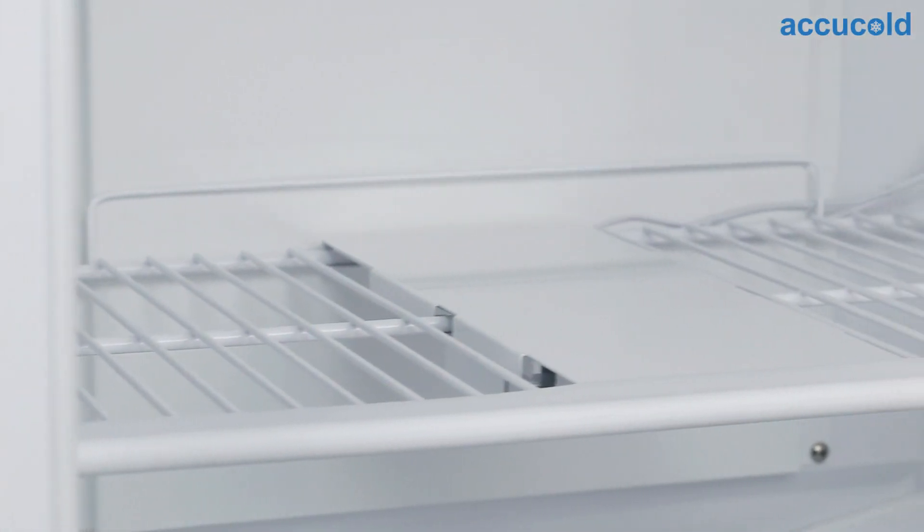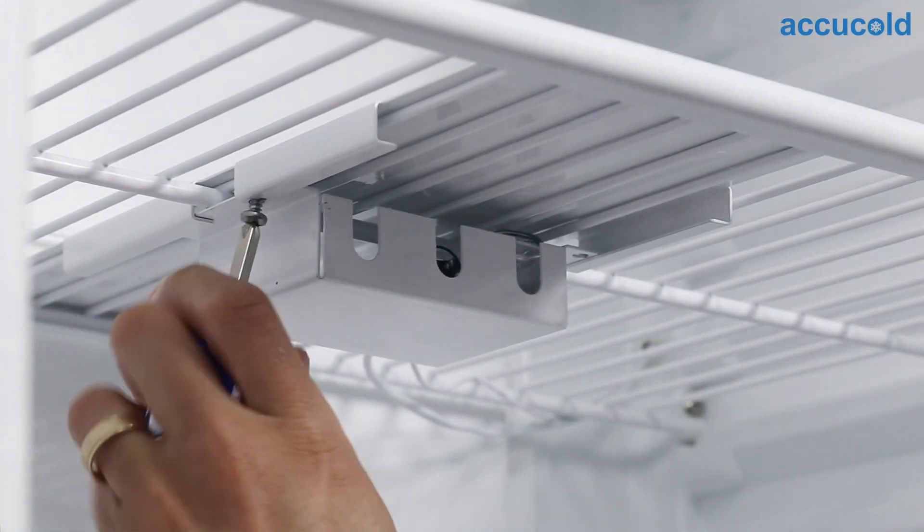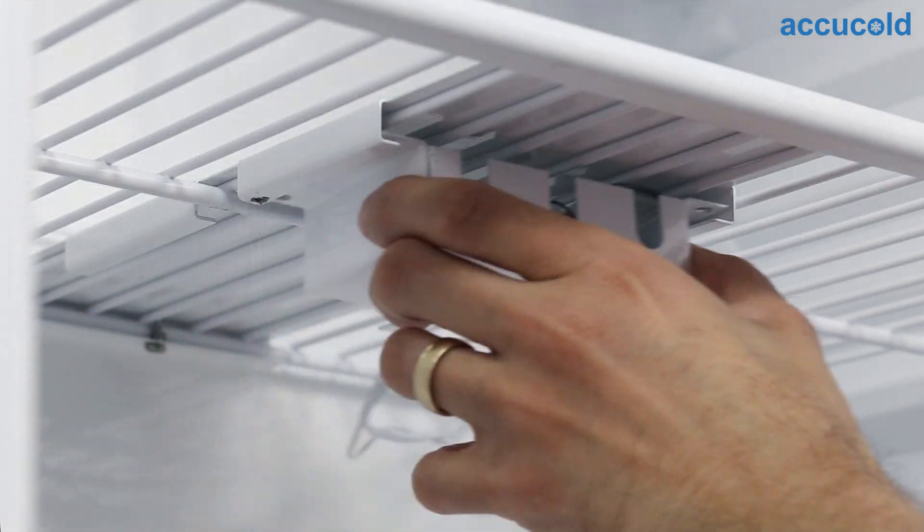If the bracket is fixed to a shelf, remove the screws on the underside of the shelf. Then slide the bracket forward to reveal the probe.